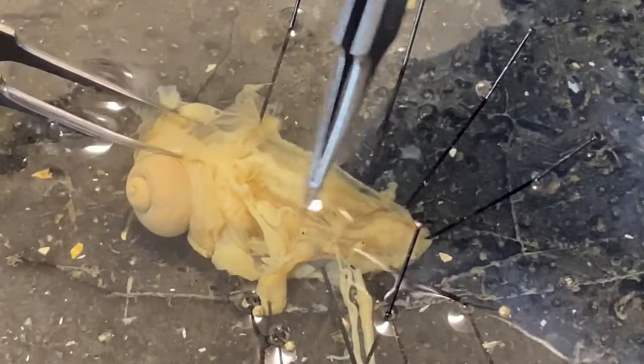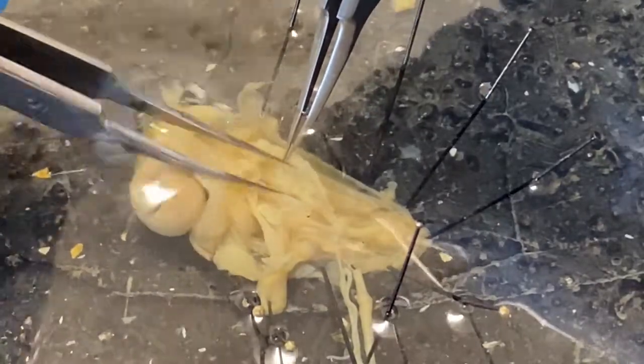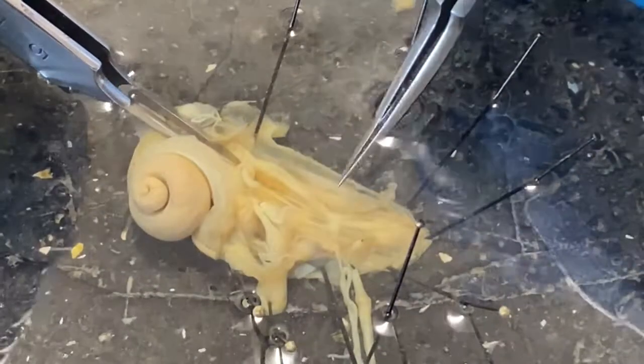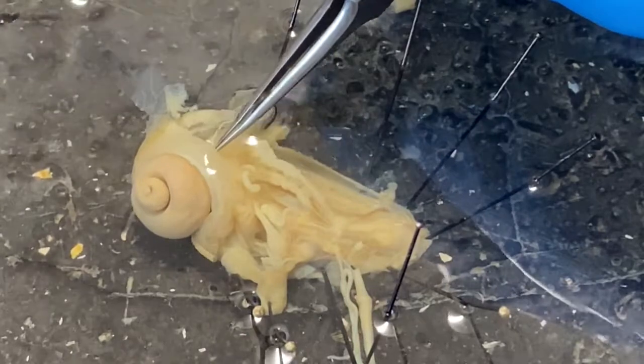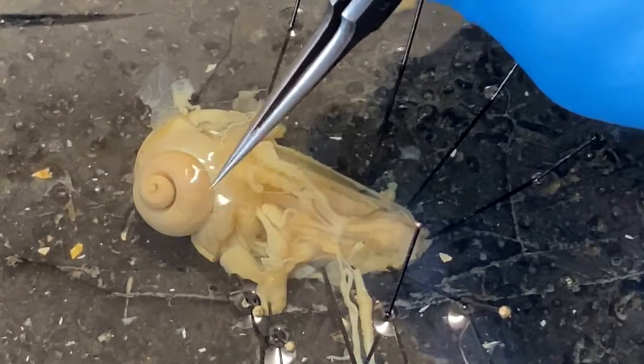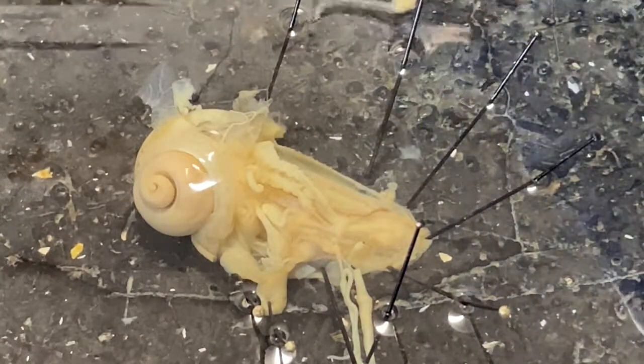Most of this material up in here is reproductive. We have the dart sac, penis, mucus glands, vas deferens, and oviduct — all reproductive. Over here we have the pharyngeal bulb, esophagus, cerebral ganglia wrapped around it, then the crop, which turns the corner, goes into the intestine, loops back around, and releases its material. Up in here we have ovotestis at the top, and this other material is the vitellin gland or yolk gland — sometimes called the albumin gland in the lab manual.